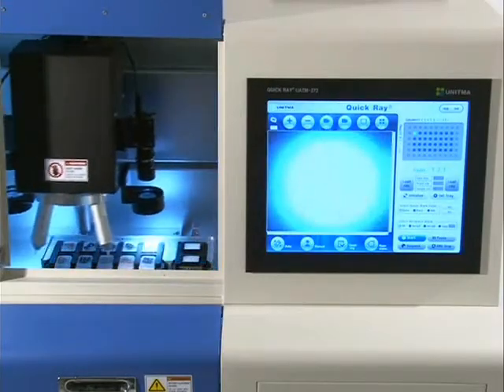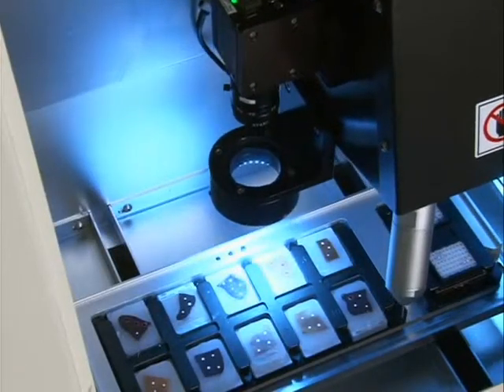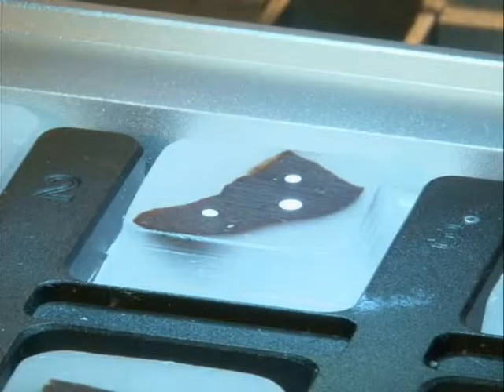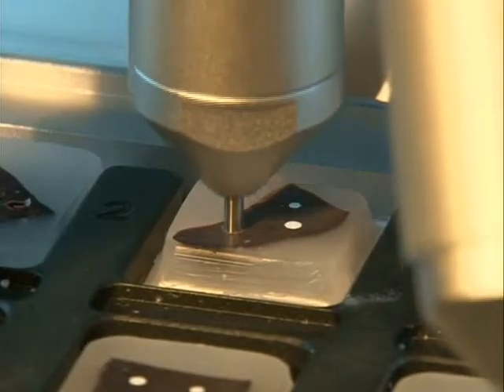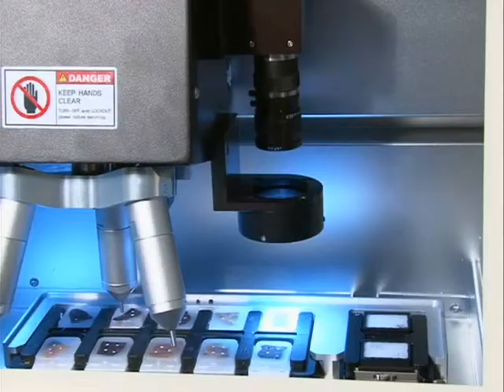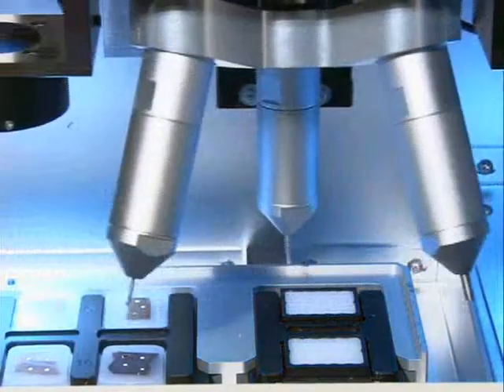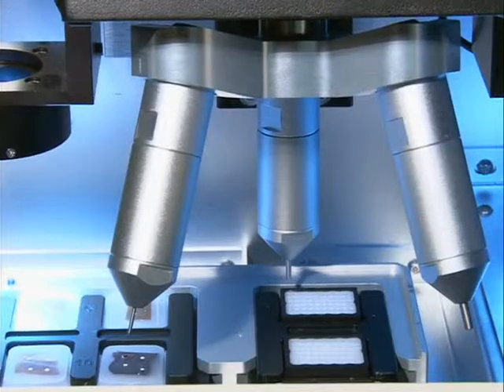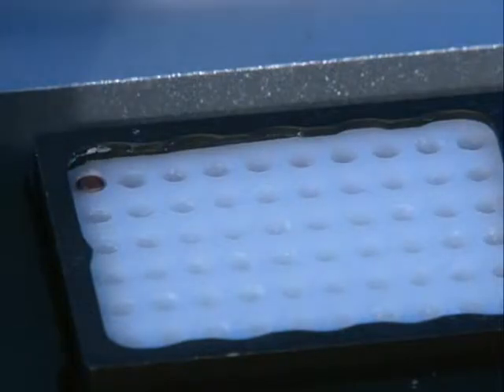The basic operation of this instrument is divided into 8 steps. First, the camera moves to a donor block. Second, capture a tissue sample image from the donor block. Third, get the coordinates of the sample. Fourth, pick up the sample. Fifth, the camera moves to a recipient block. Sixth, detect the center of the hole of the block. Seventh, calibrate the coordinates of the block to move the tip. Eighth, insert the sample. These 8 steps are included in one cycle.